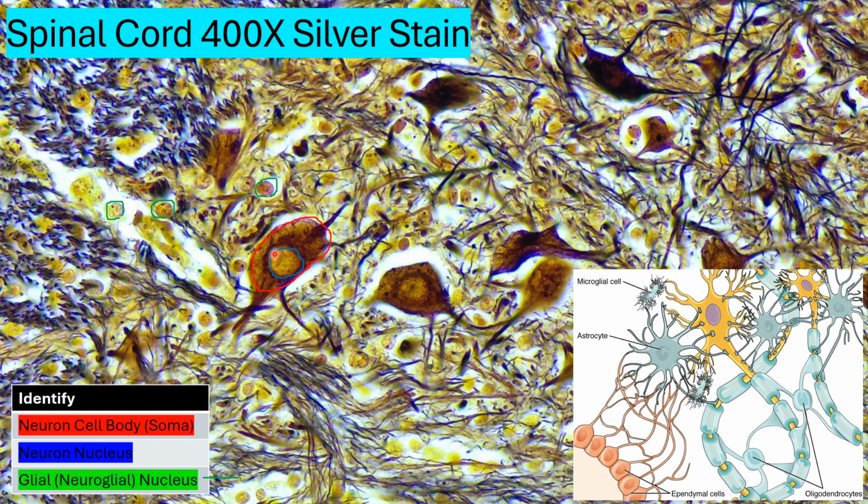So how do we identify this as nervous tissue? First, we look and we find a fairly large soma containing a nucleus and these beginnings of these neuronal processes here. And then we identify that there are nuclei, these smaller ones, that greatly outnumber our neurons. Note also the size difference between a neuron and our glial cell, at least the nuclei, we can clearly see that as well. So that's our first sample. Let's look at two more.